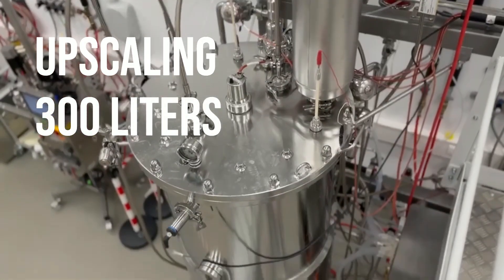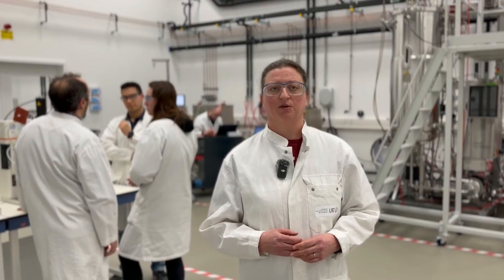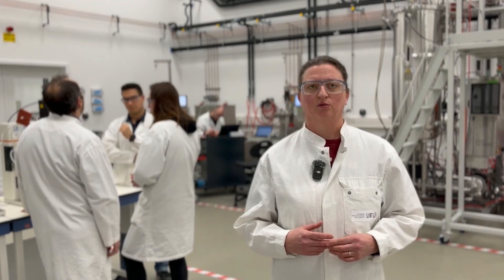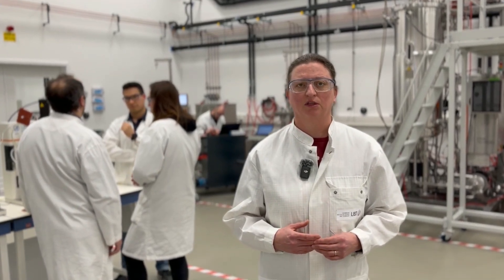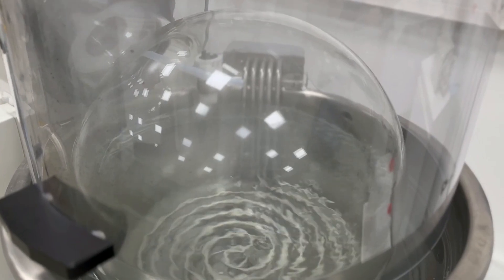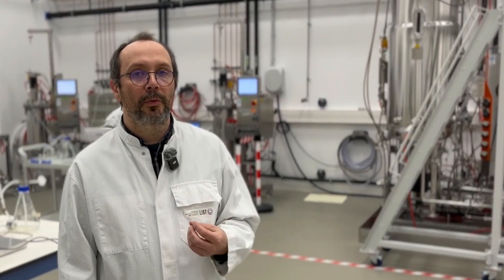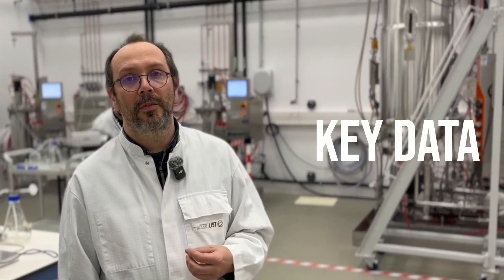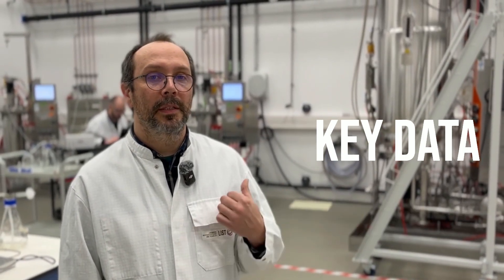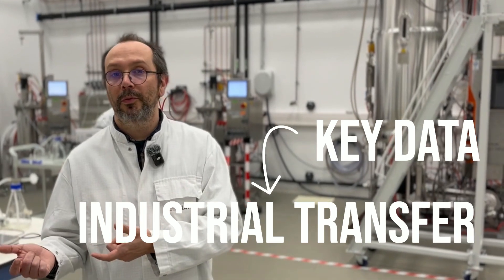With this, we will reach the pre-industrial scale, and this is where we have this niche that allows us to go quite close to the market. Using these facilities, we are able to calculate key data such as the cost efficiency of our product, and also to validate that these processes are transferable to industrial partners.